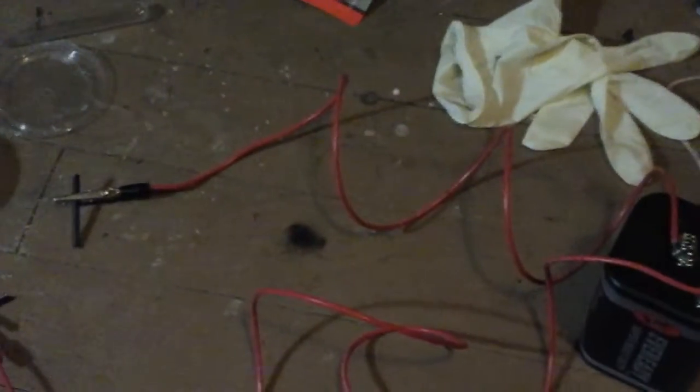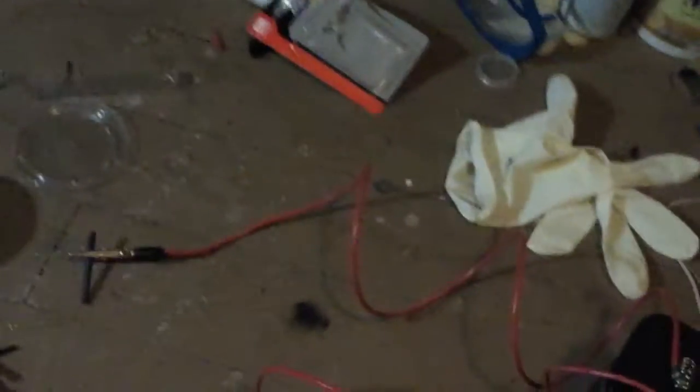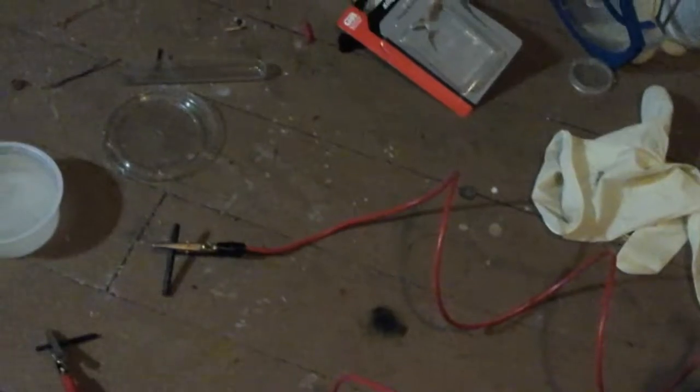Because I tried to use just regular copper wire as the cathodes and anodes, and this happened — the solution ate the copper. The copper ions dissolved inside because of the electricity.